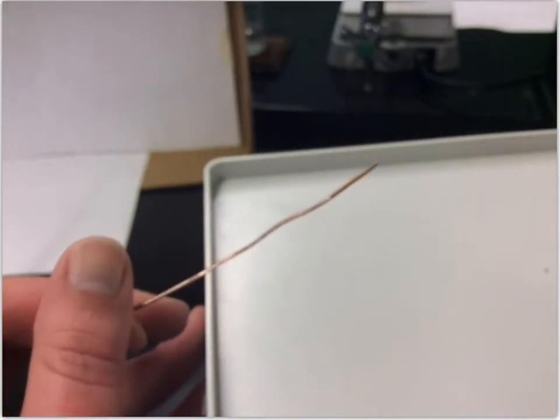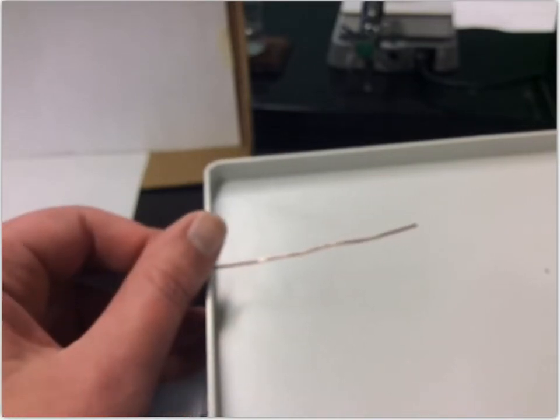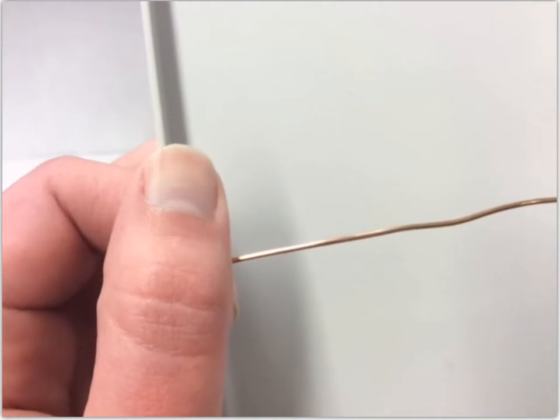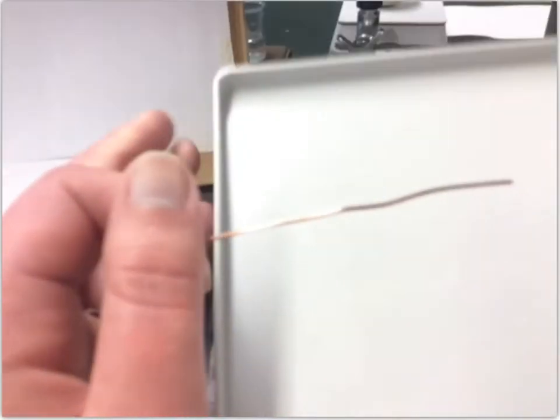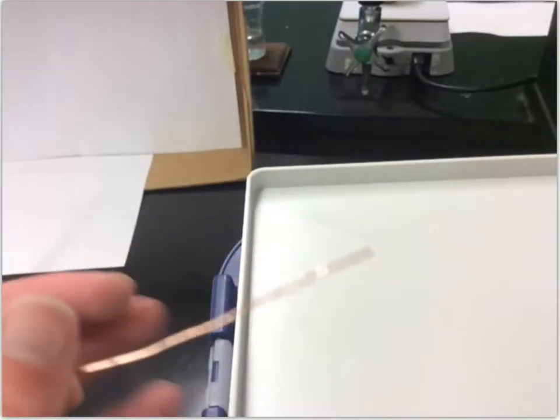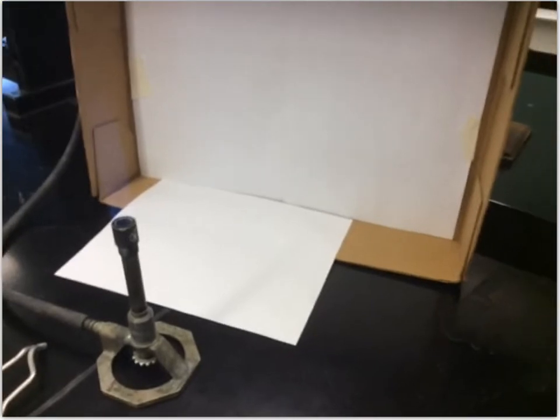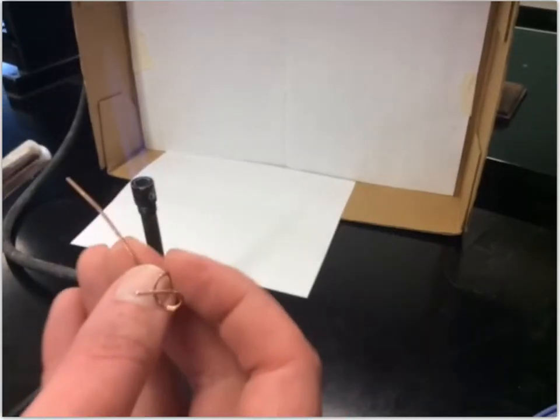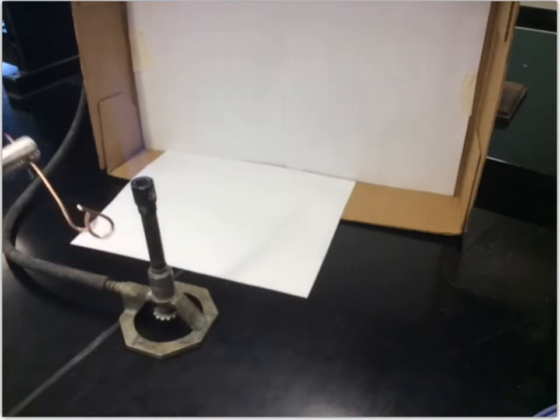For the last part of the experiment we're going to take a piece of copper wire — you can see this shiny piece. We're going to react it with oxygen gas. Right now even in air it's slowly reacting, but we're going to speed up this reaction by putting it into a flame — the heat helps speed up the reaction. I'm going to hold it with tongs and coil a little bit of it up so I can get more than just a straight piece into the flame.